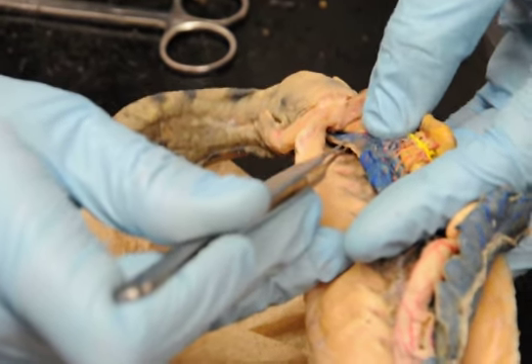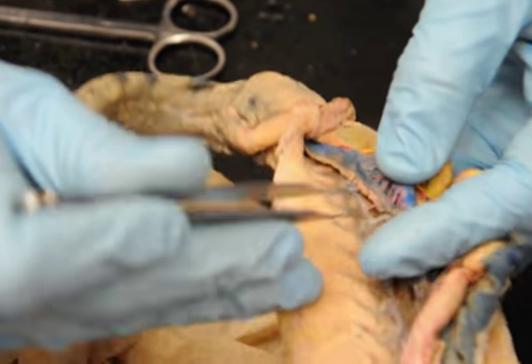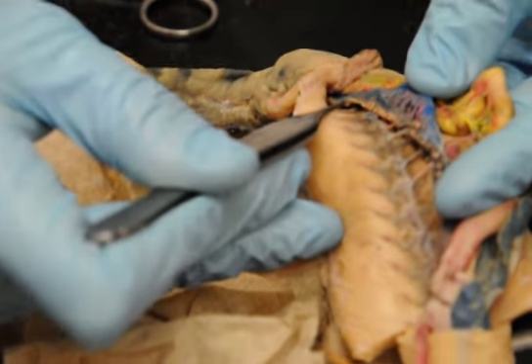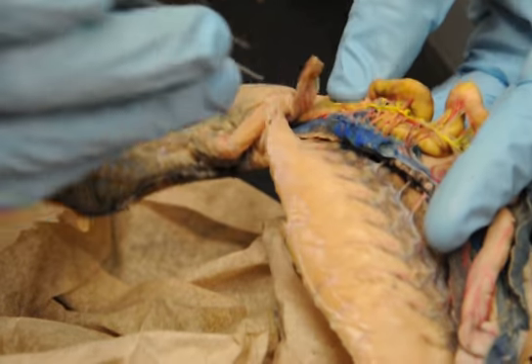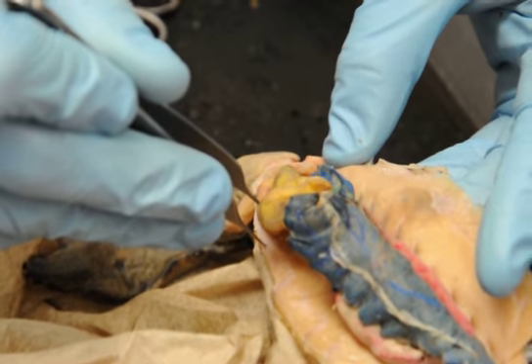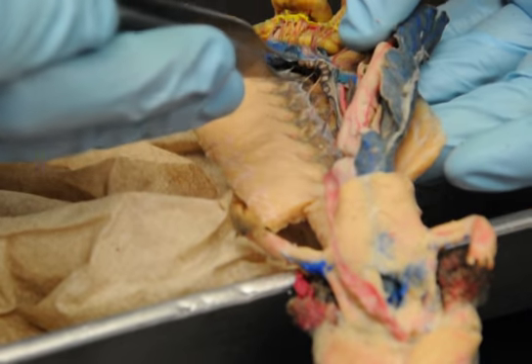So when you see something running along the edge of the kidney, that's actually the mesonephric duct in the male. So this is the efferent duct here. In a female, if you saw squigglies like this, that would be the oviduct. We talked about that earlier. Bladder. And what else have we got? Anything else? Posterior cardinal vein.